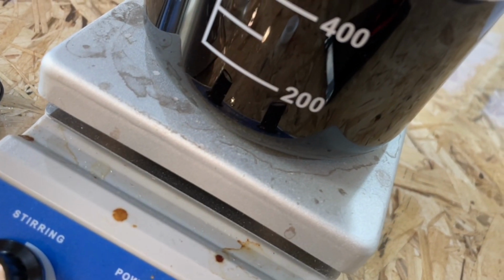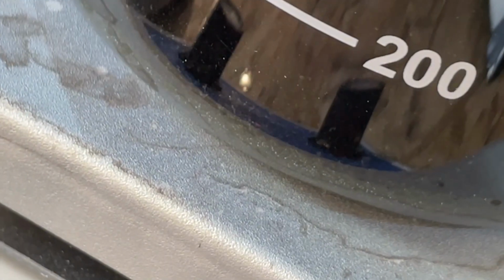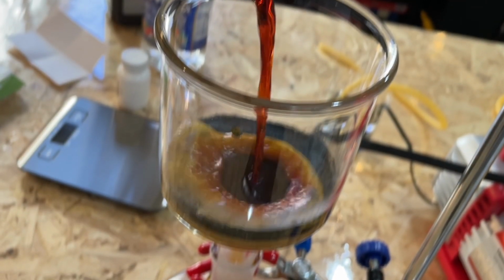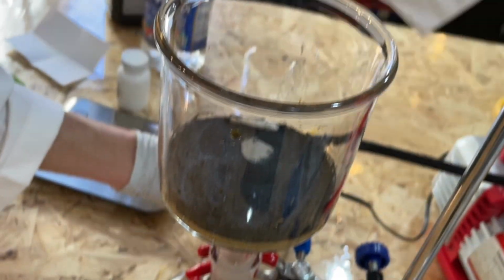After a few minutes, significant iodine precipitate has appeared at the bottom of the beaker and no more iodine precipitate seems to be forming. A vacuum filtration with a Buchner funnel was set up and the mixture was filtered through to collect the iodine precipitate. The precipitate was washed with some deionized water.